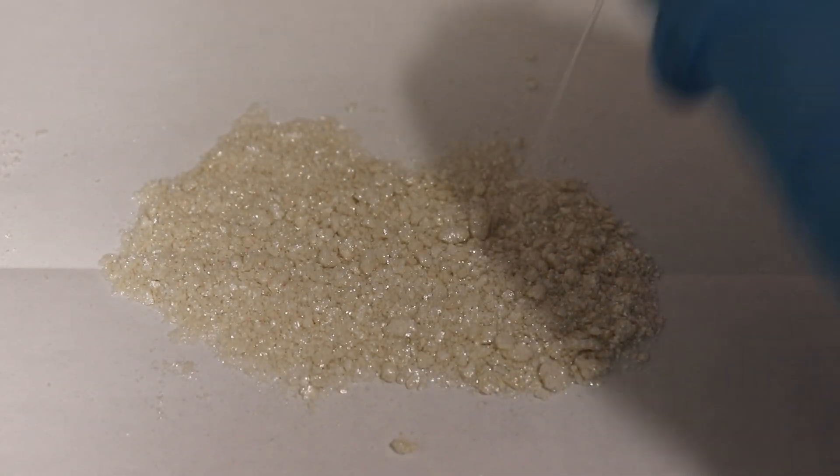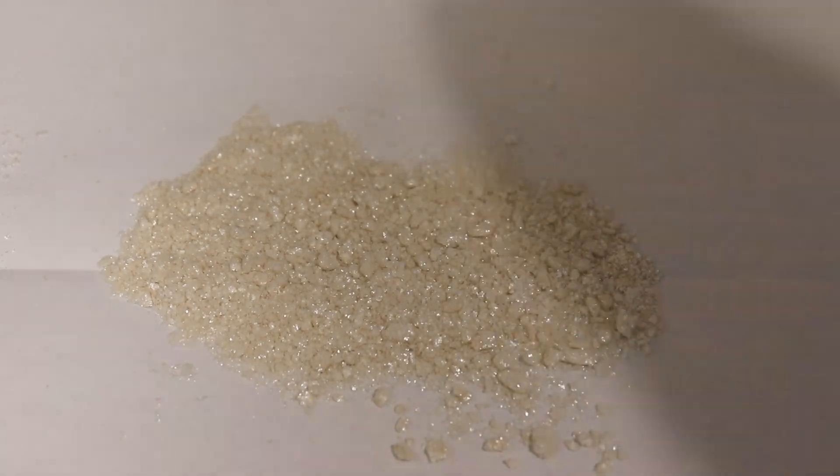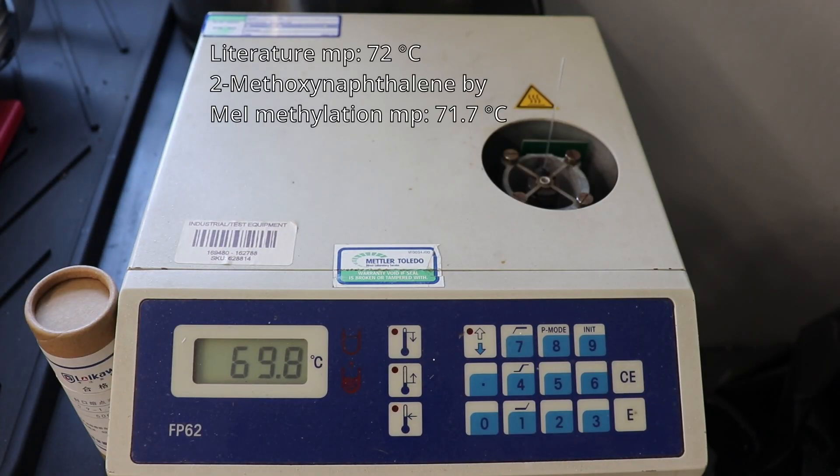After being allowed to dry in air, the melting point was taken at a rate of 0.3 degrees Celsius per minute, finding the melting point to be 71.7 degrees Celsius, which is an excellent result.